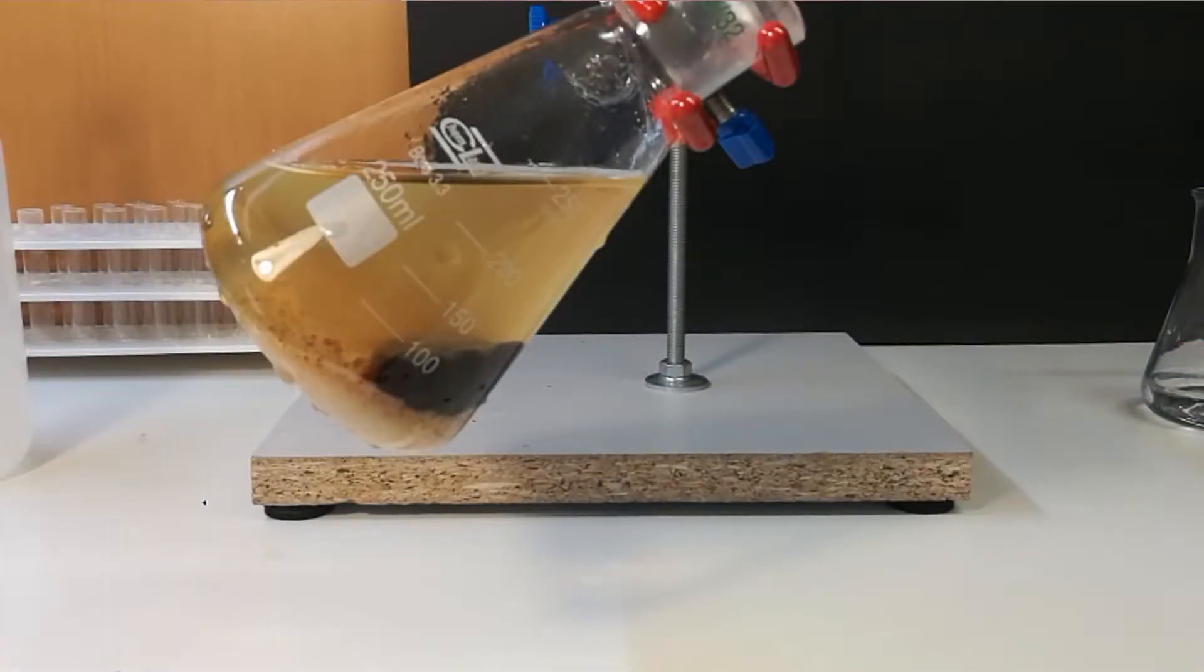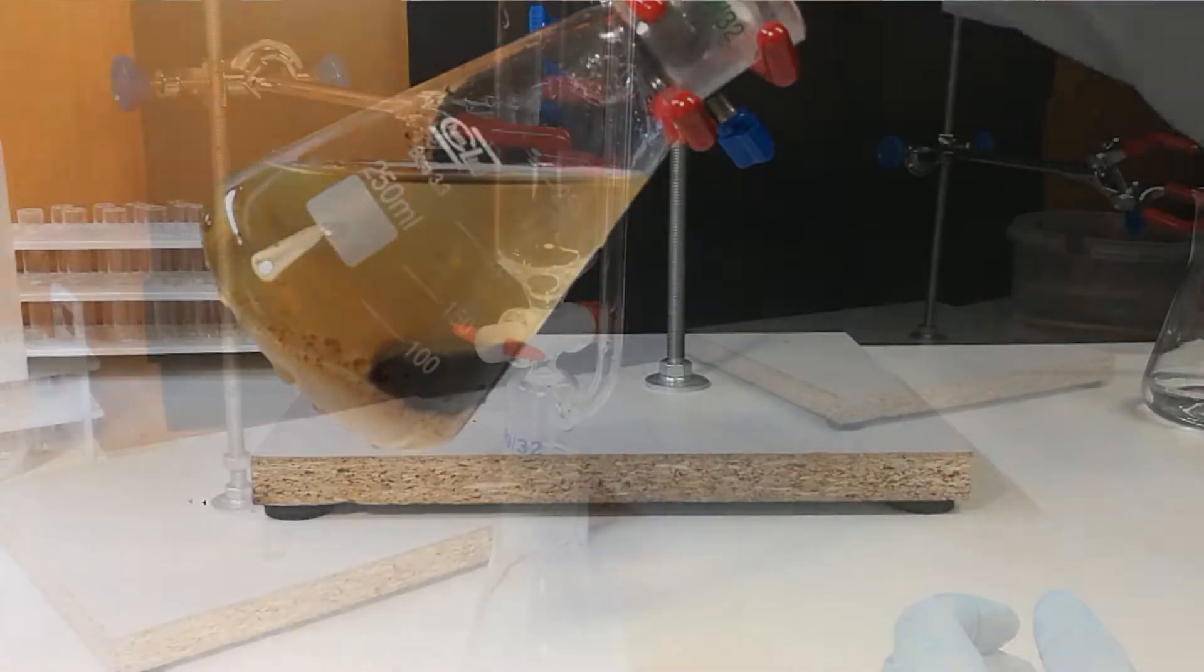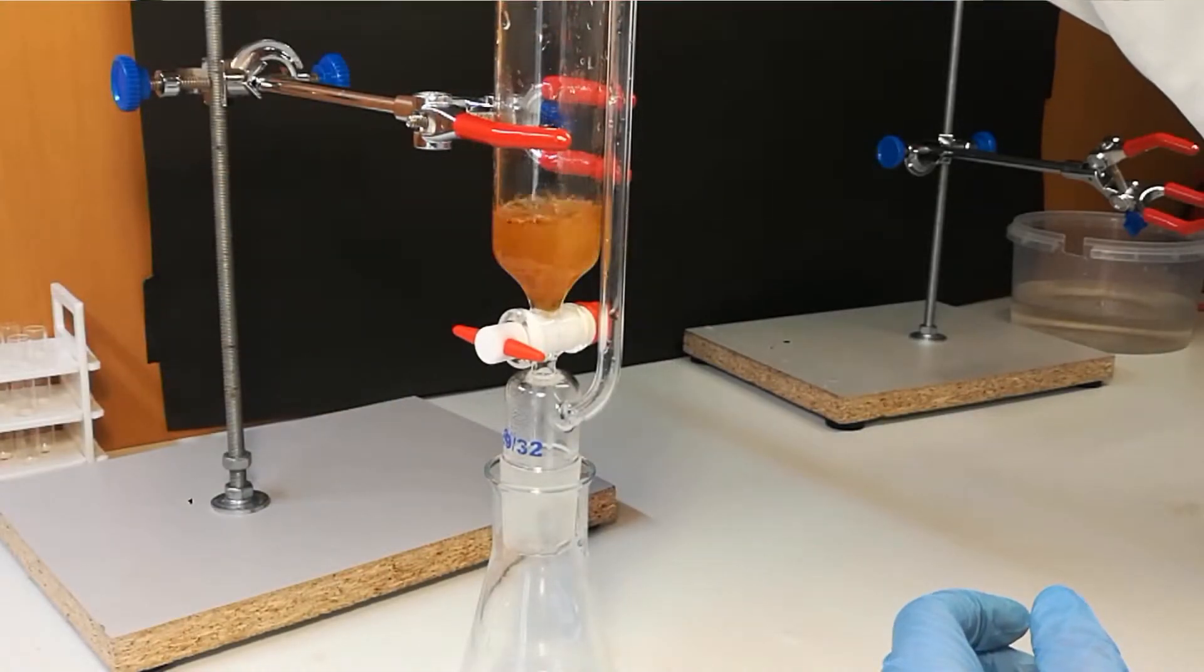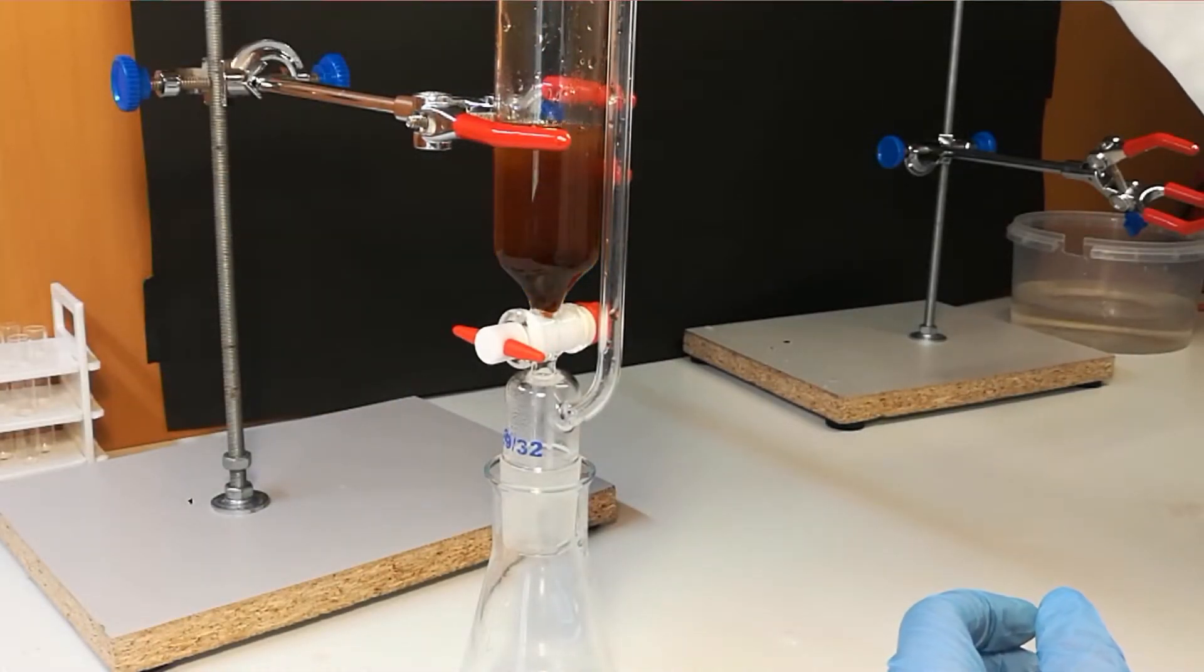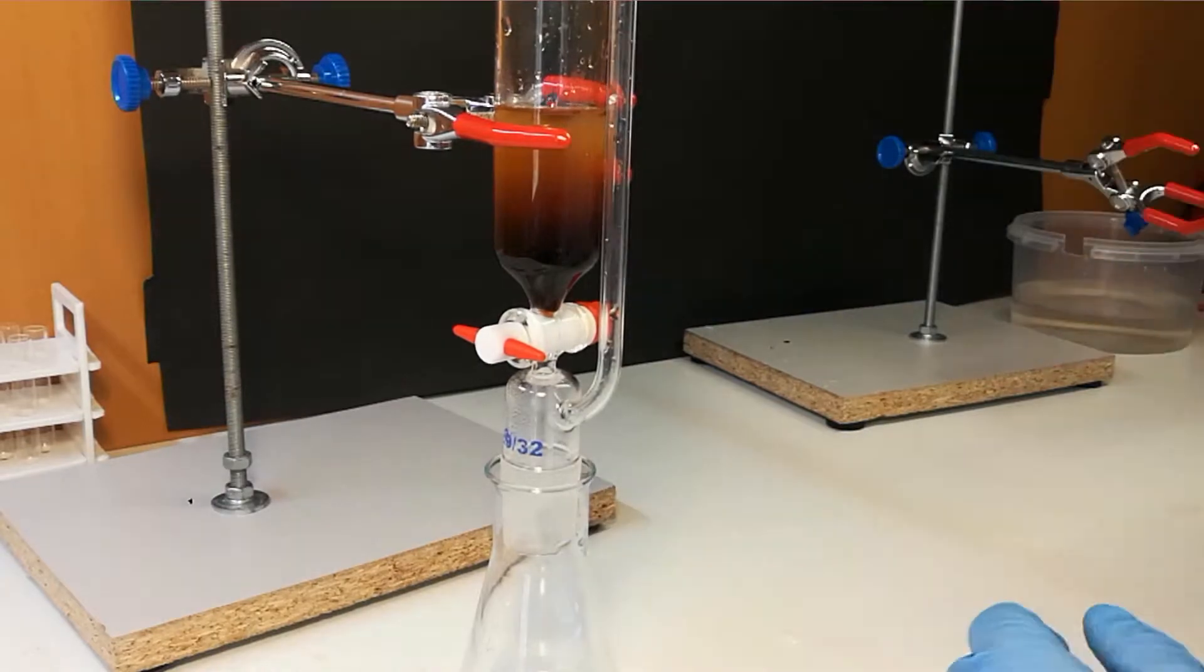This black oil is our product. Pour mixture to separatory funnel and get only bottom fraction to round bottom flask and close it with stopper and clip.